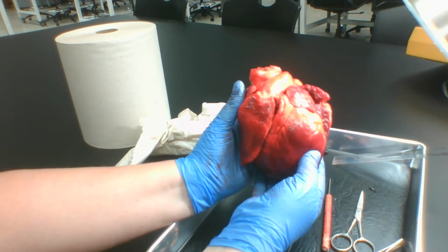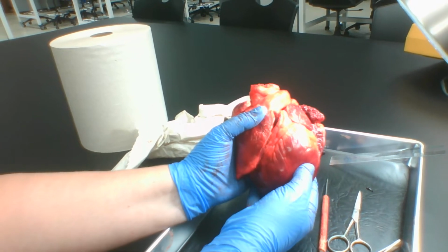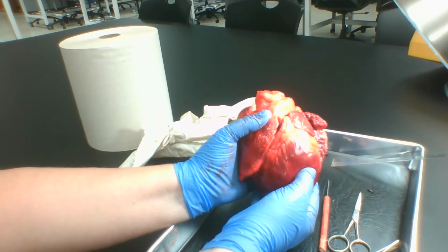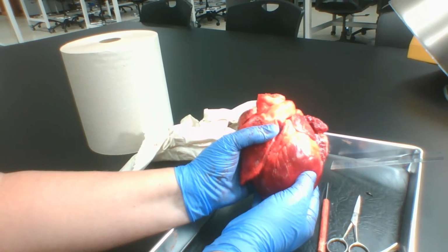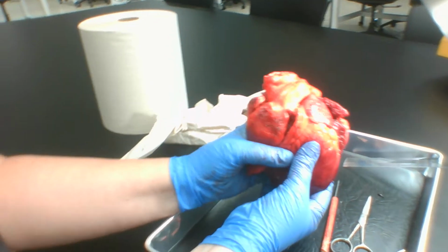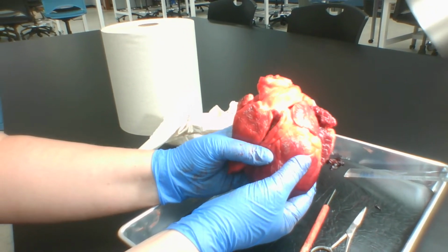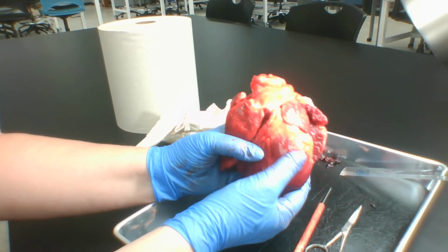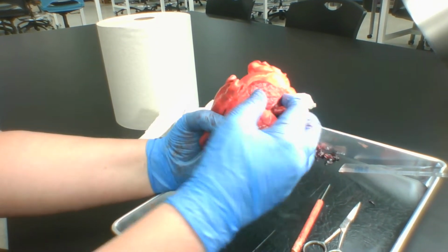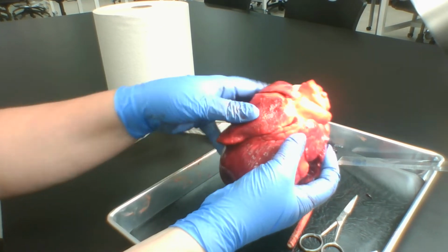So we are back to the anterior portion of the heart. When we left off, we had deoxygenated blood going from the right ventricle through the pulmonary artery into the lungs to be cleaned. Now, once the blood is cleaned up in the lungs, it needs to go back into the heart via the left atrium, which is right here. And how the blood flow gets there is through the pulmonary vein.